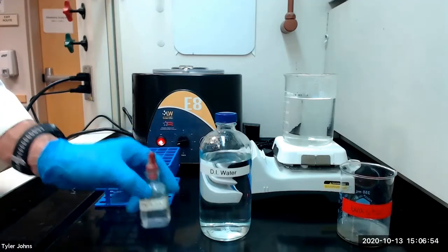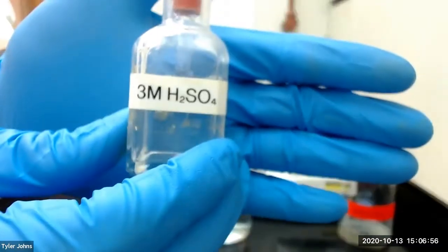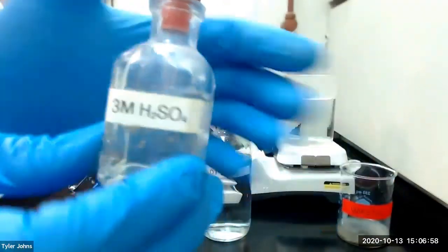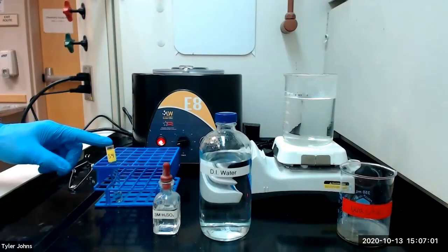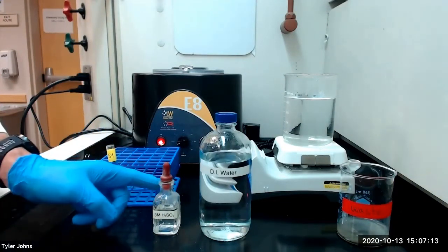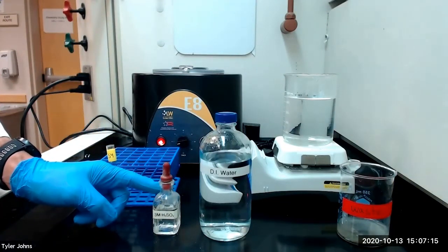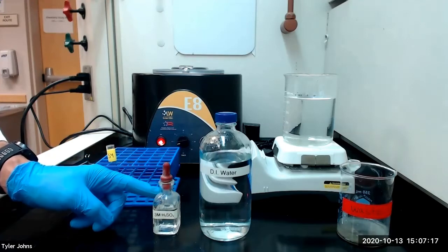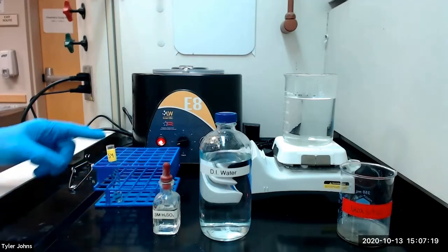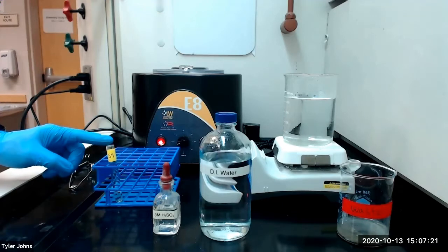We will add 3 molar sulfuric acid dropwise to solution S4 until it has been neutralized. We will then add excess 3 molar sulfuric acid equal to one third the volume of sulfuric acid needed to neutralize solution S4.